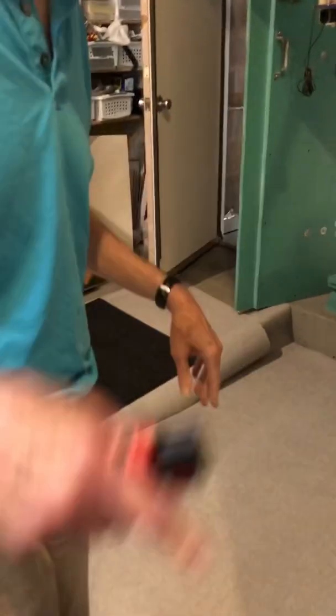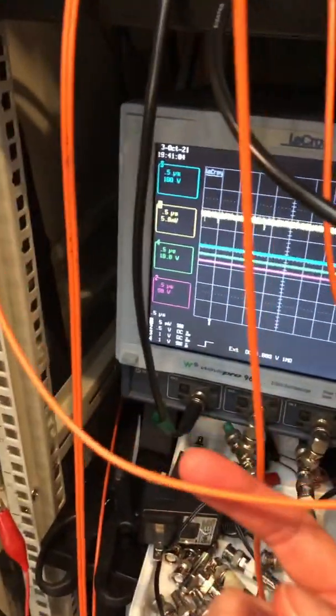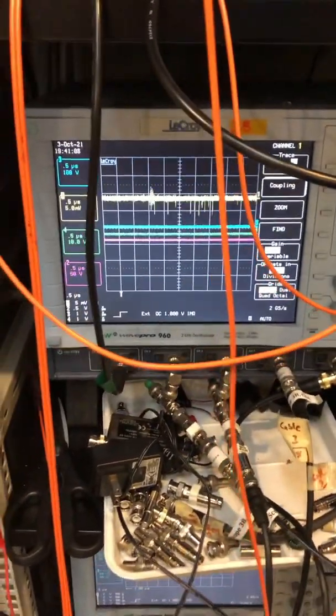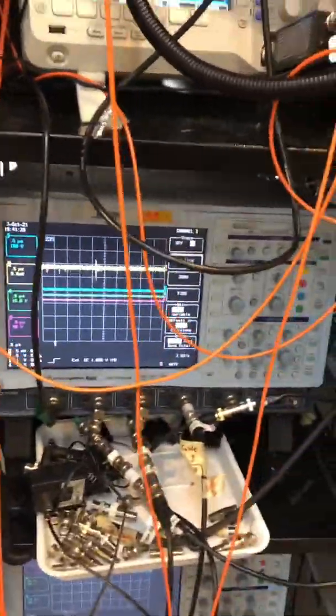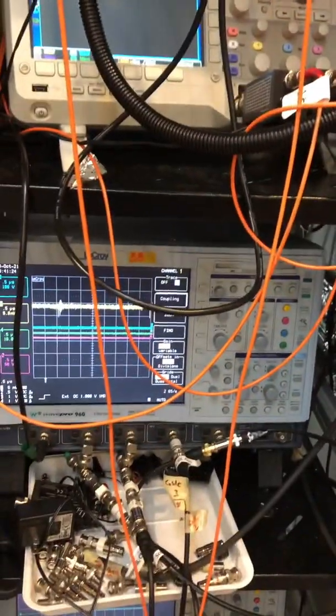The flashlight? Yeah, so you're going to watch, and I'm going to test. These are the optical fibers here? The orange? The yellow is... No. No. You can't see them there and back. So what am I supposed to do? If the signal increases, starts getting jumpier, then you say, yeah, we know that we're looking at a light leak, okay? All right. Okay.